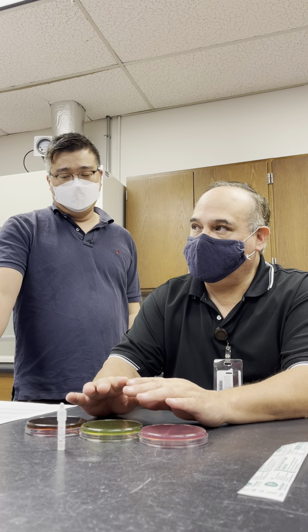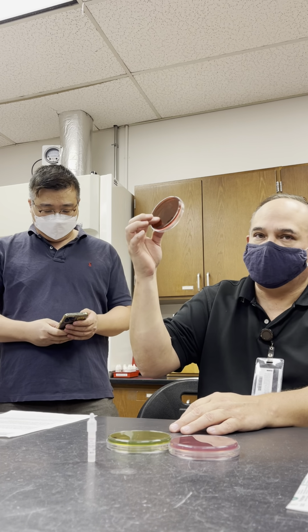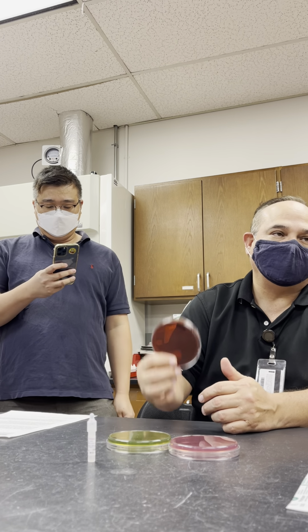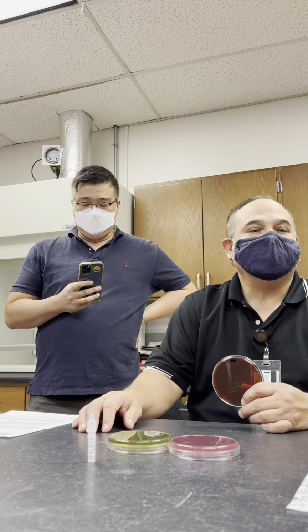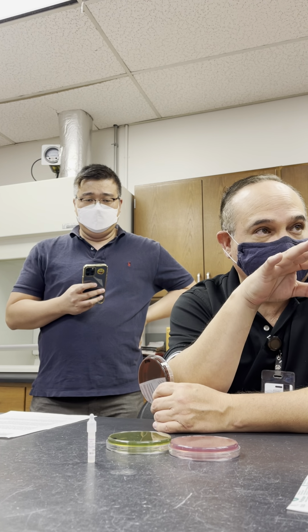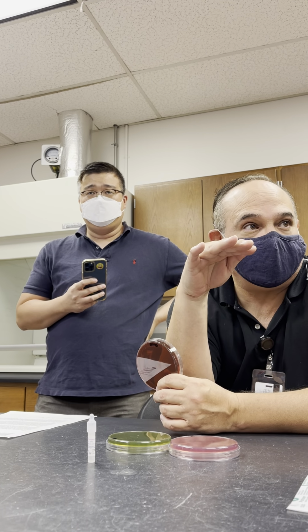The first thing I'm going to talk about is the plates, then oxidase, and then we're going to do the demonstration. The first one is known as EMB. EMB stands for eosin methylene blue. In this media, you have the pH indicator eosin. All the gram-negative enteric bacilli ferment glucose.